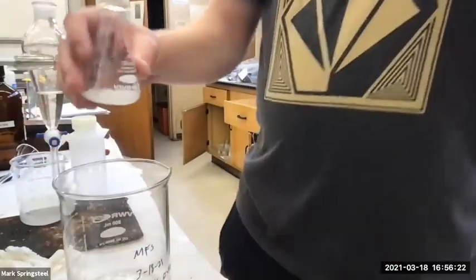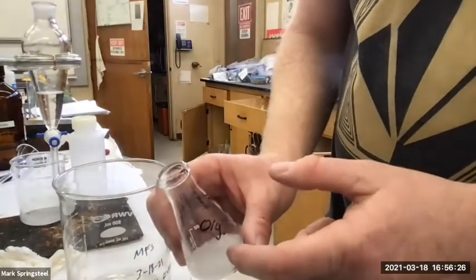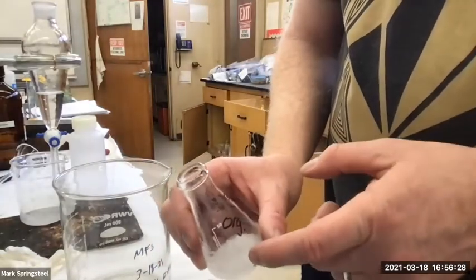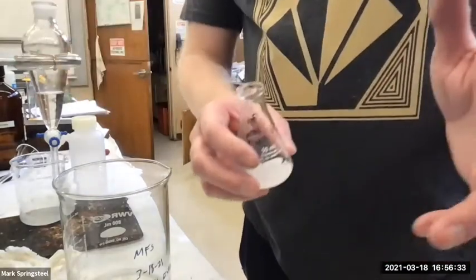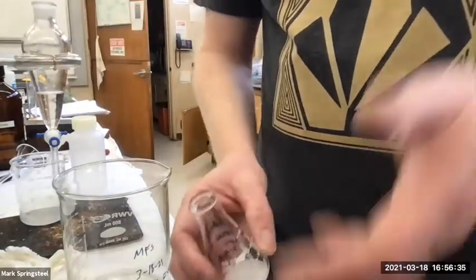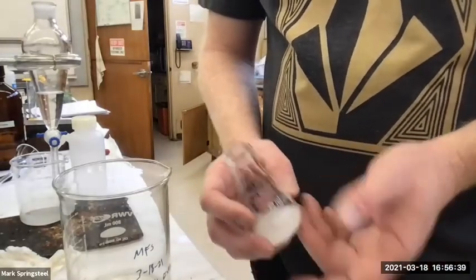Looks pretty good. And this sodium sulfate hydrate, it has some methylene chloride on it. So I don't want to wash this down the drain right now because of the methylene chloride. So what I'll do is I'll just let this sit out, keep it in my locker till the next lab period. All the methylene chloride would have evaporated, then I can wash the sodium sulfate down the sink drain. It's just sodium sulfate and water. Okay.